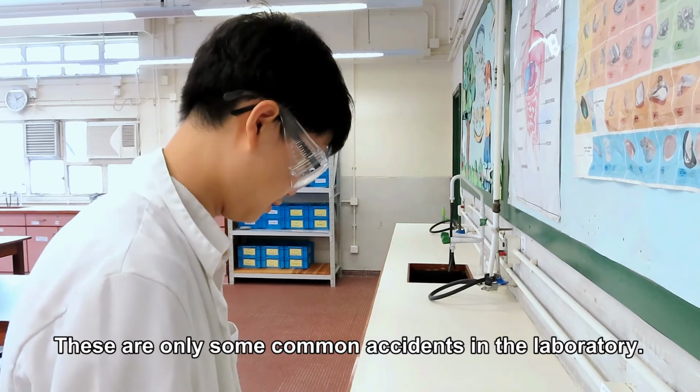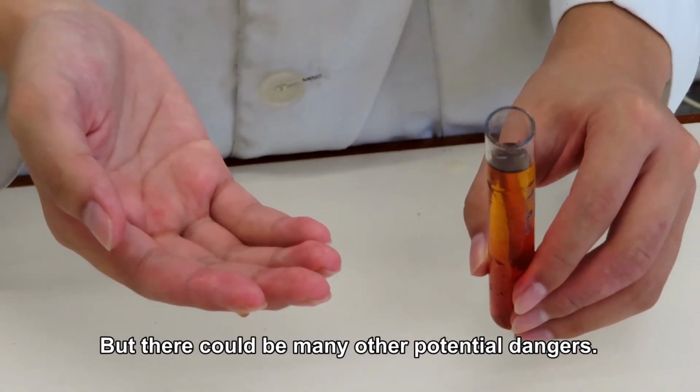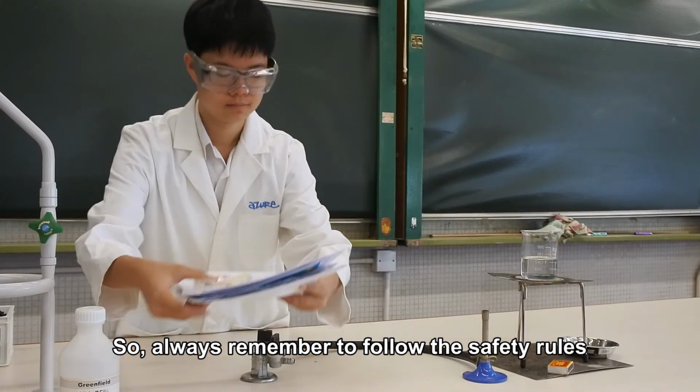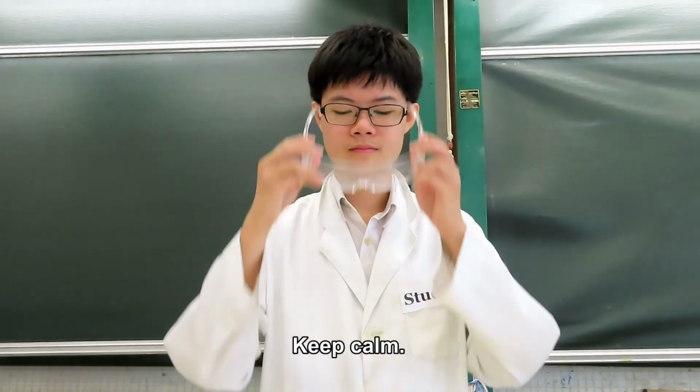These are only some common accidents in the laboratory, but there could be many other potential dangers. So, always remember to follow the safety rules when you're working in the lab. Keep calm and stay safe.